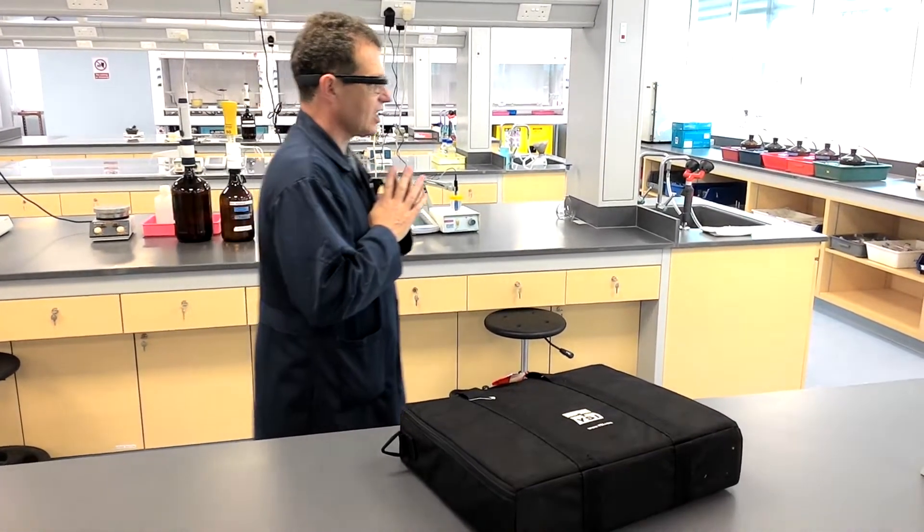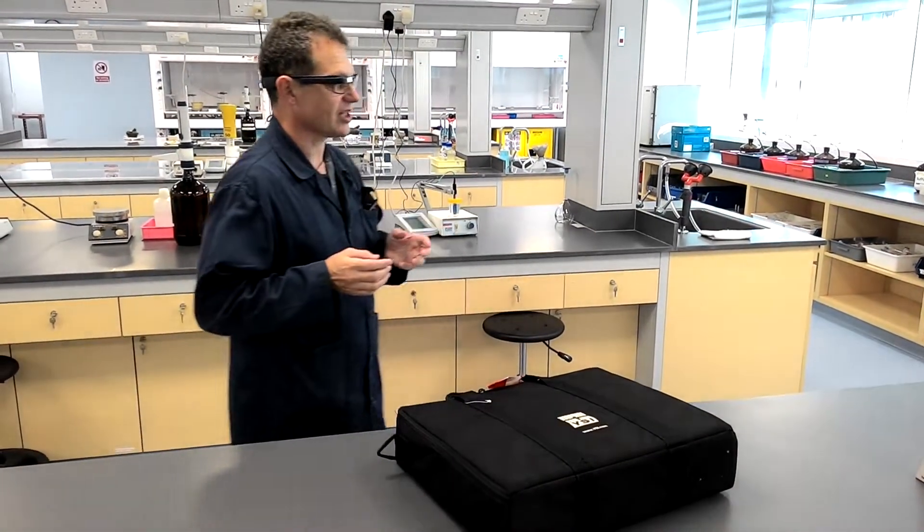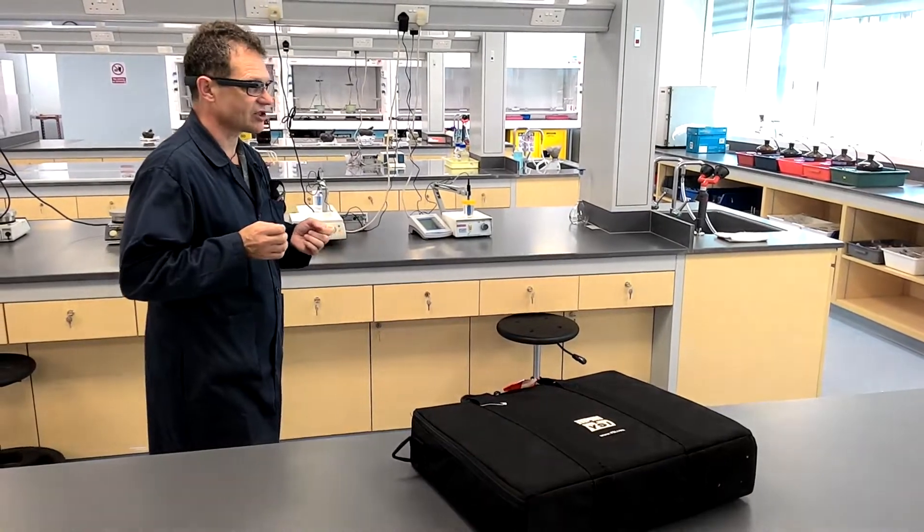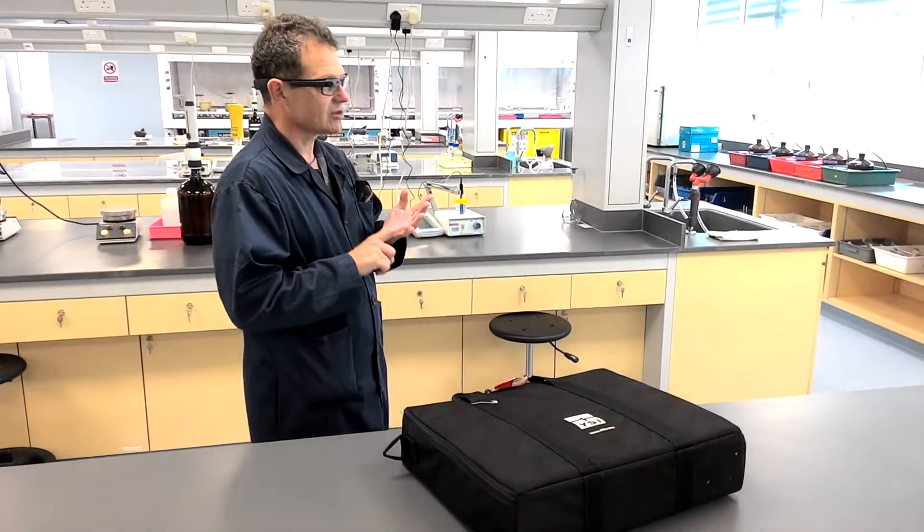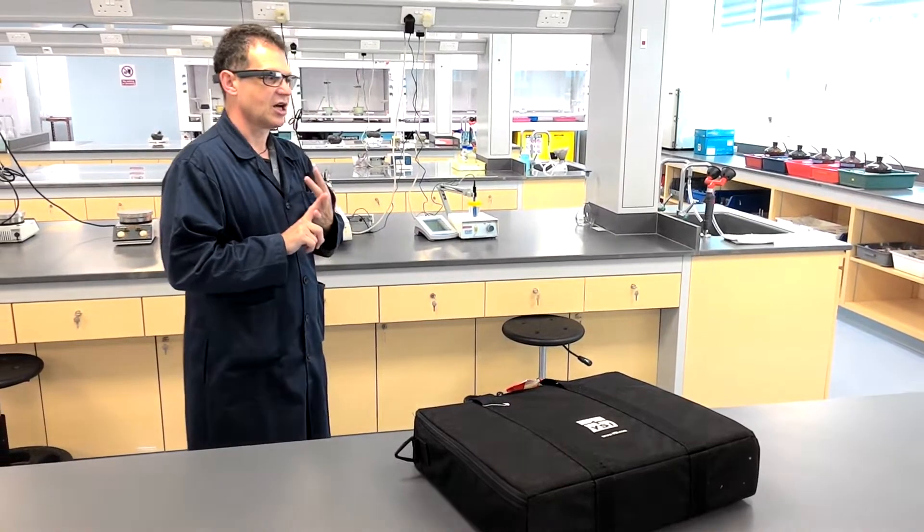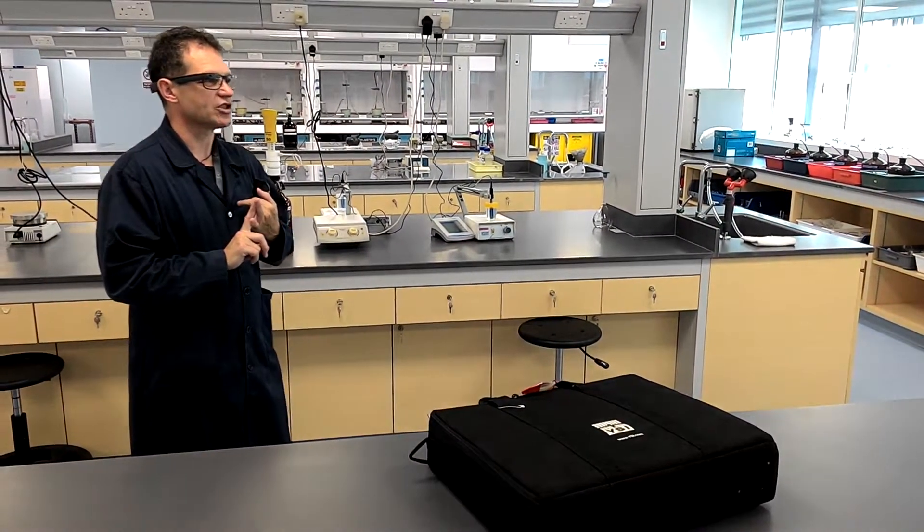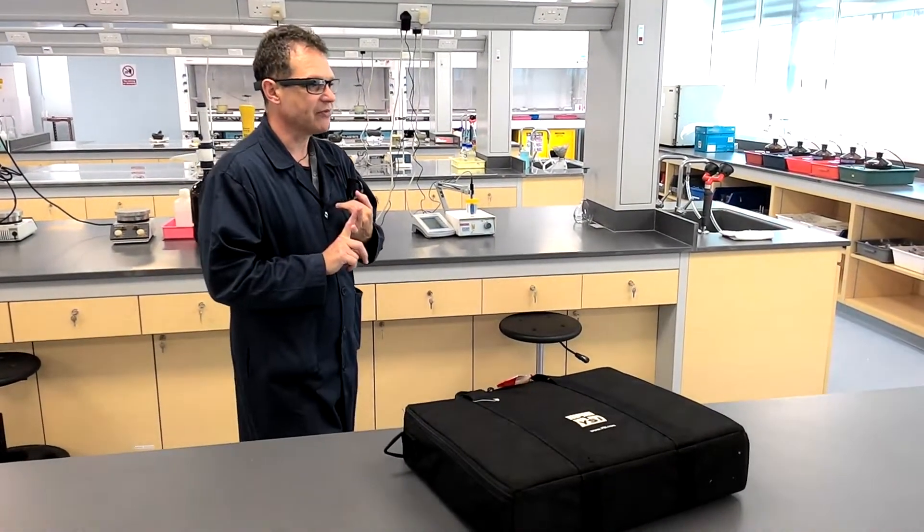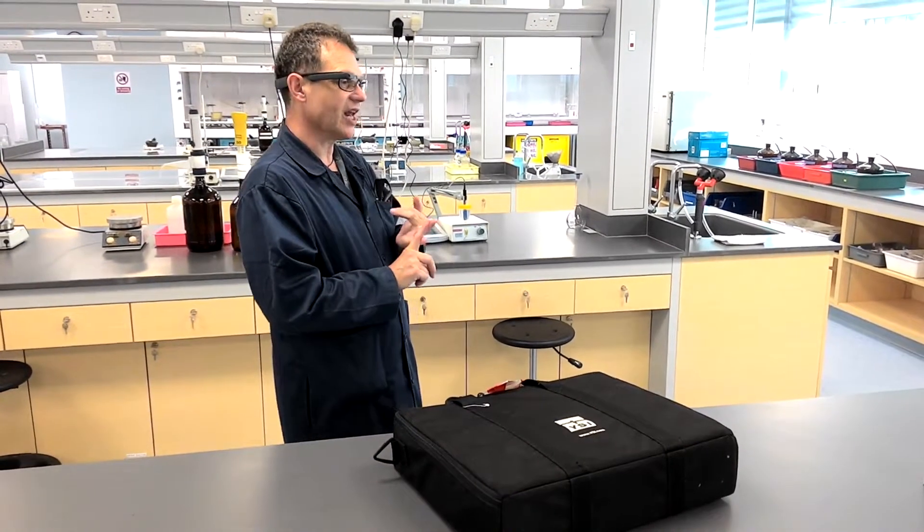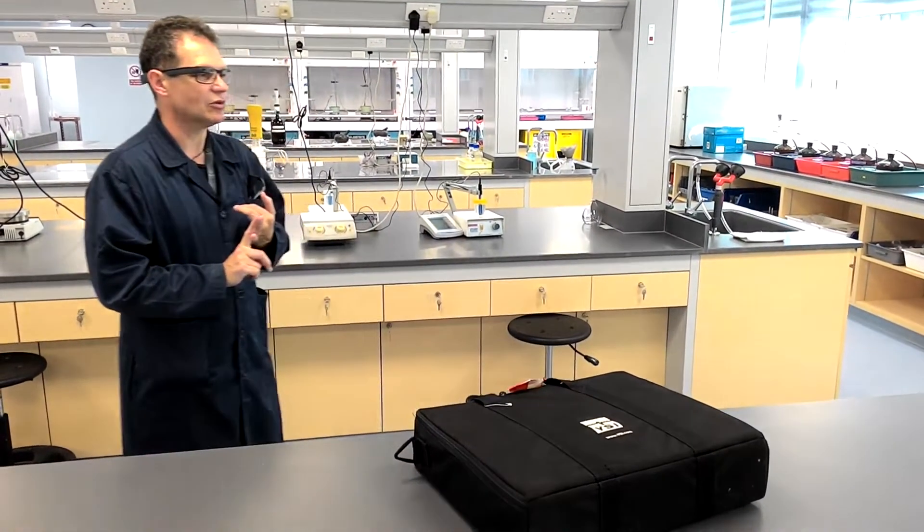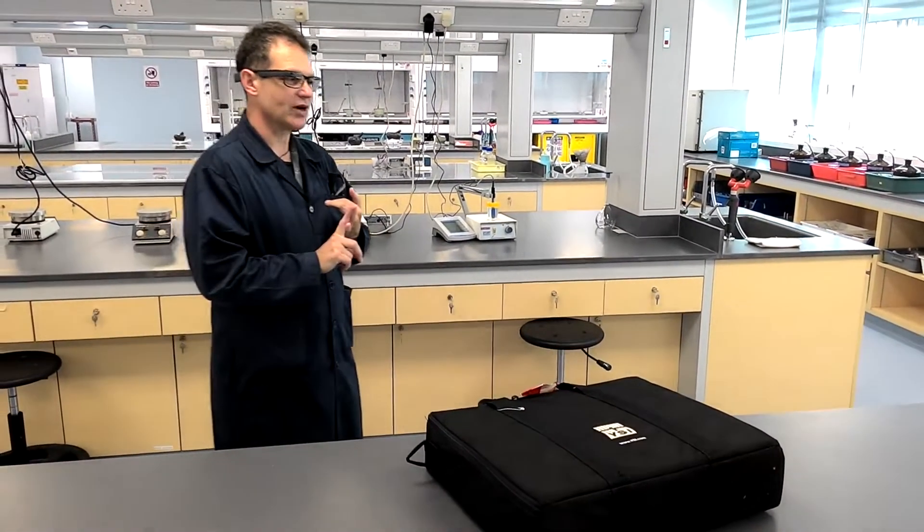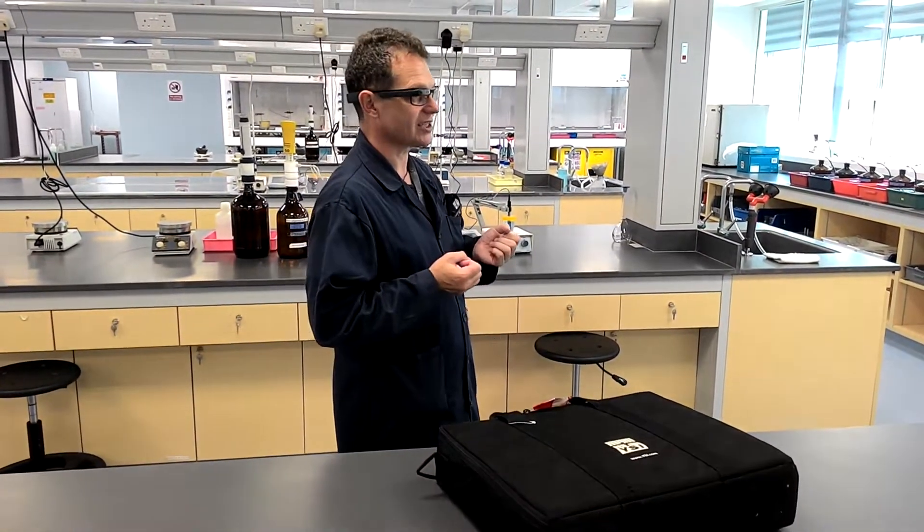However, I'm going to just demonstrate the use of dissolved oxygen because dissolved oxygen and pH are probably the two exceptions where measuring them in the river or in the lake at the time you take the sample is likely to be more representative of the conditions in that river or lake.